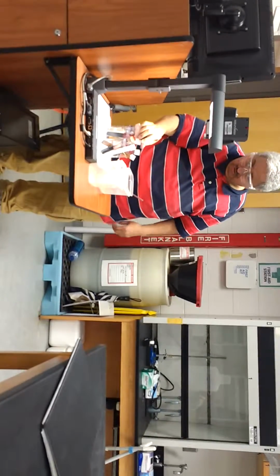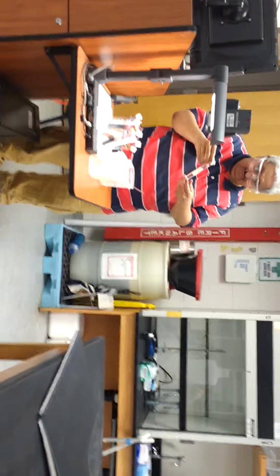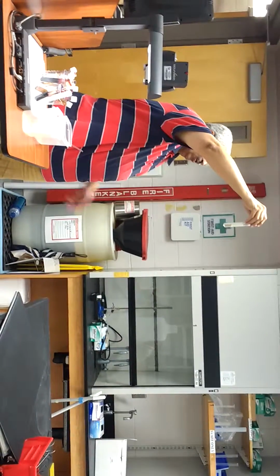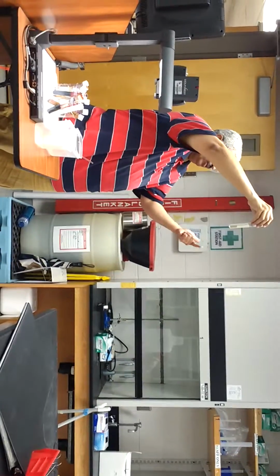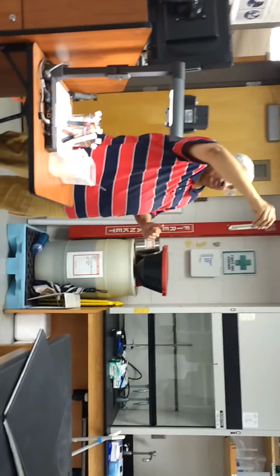Now, on the other hand, let's take the oil and cyclohexane. That's the oil and cyclohexane. Can you see two layers? No. Oil is non-polar, cyclohexane is non-polar, so non-polar dissolves what? Non-polar compounds. So that's oil.